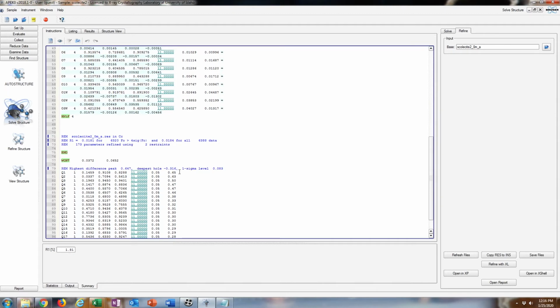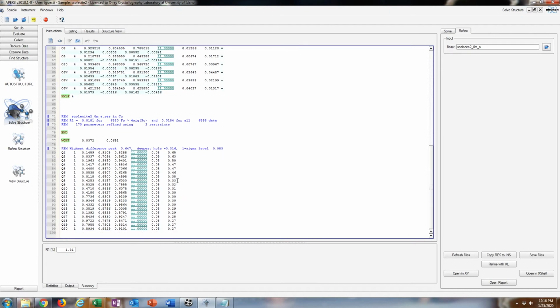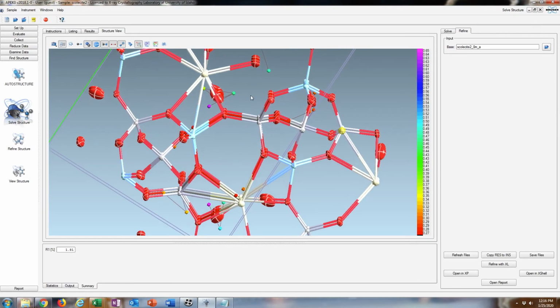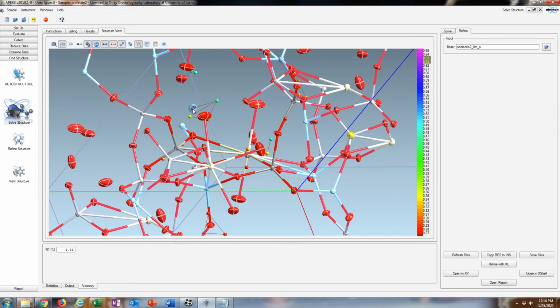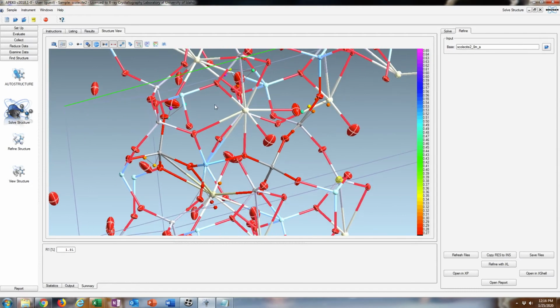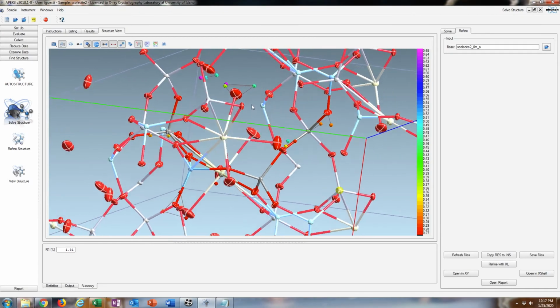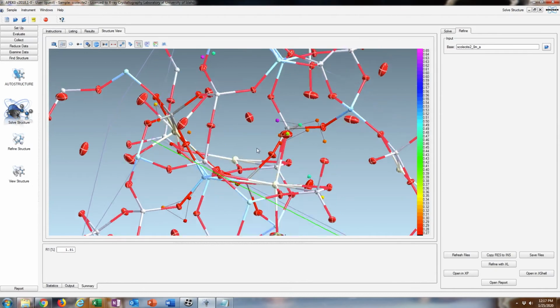Alrighty. So now I'd say, since there's not that much to deal with in this structure other than the hydrogens, it's about time to work on those. So some of these possible Q peaks here are possibly hydrogen atoms, and I'd say the top 6 are candidates for being hydrogens in this example, because of the electron density, or the difference electron density. And you can actually see them. That purple one there is Q2, and that sounds about right. It's about the right distance from the oxygens. In general, the Q peaks are centered a little bit close to oxygens when they are, say, waters, but that's okay.